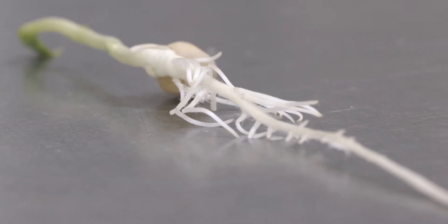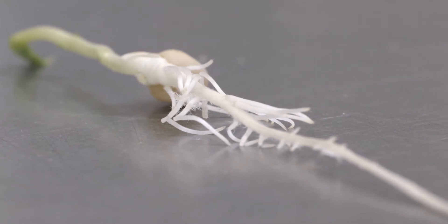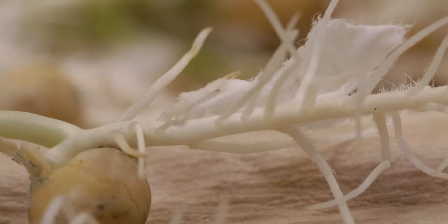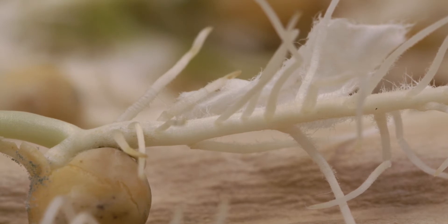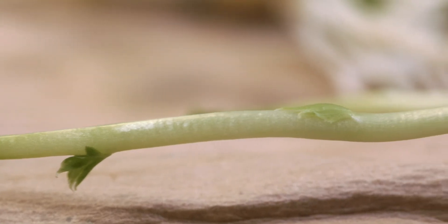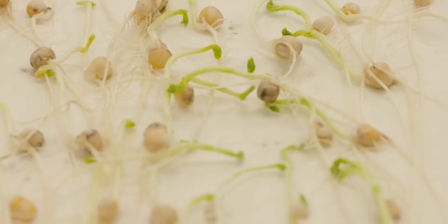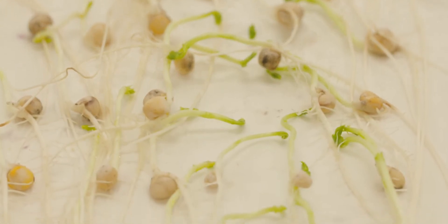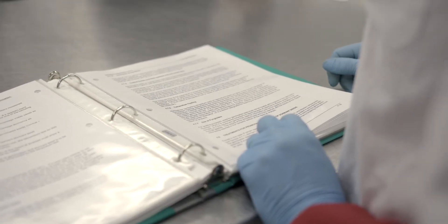Normal seedlings possess all the essential structures that are indicative of their ability to produce normal mature plants under favourable field conditions. The normal seedlings have long, healthy root structures and a primary leaf or cotyledon, depending on the species being tested. Minimum germination grade table requirements are 85% or over for certified number one on cereals.